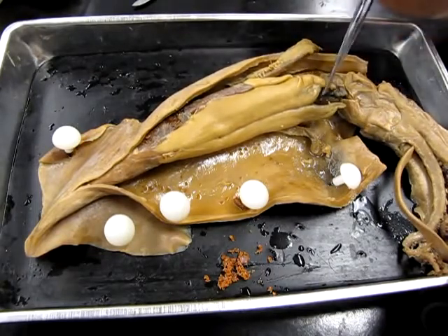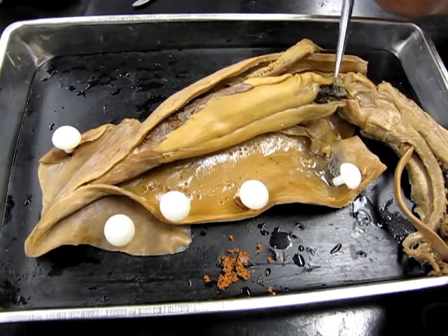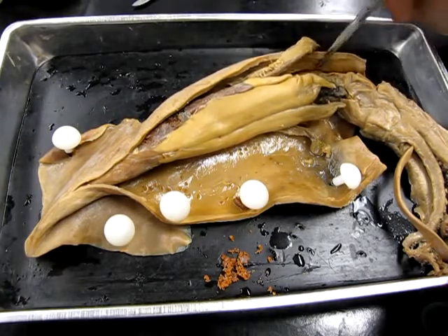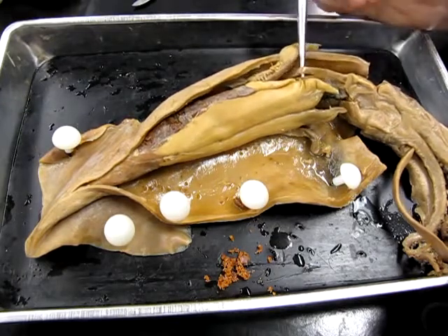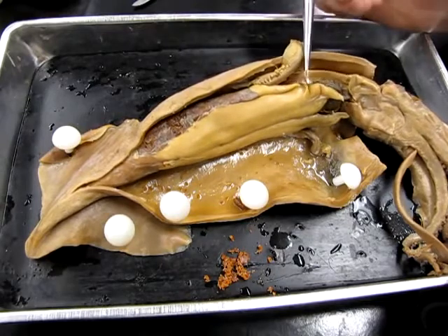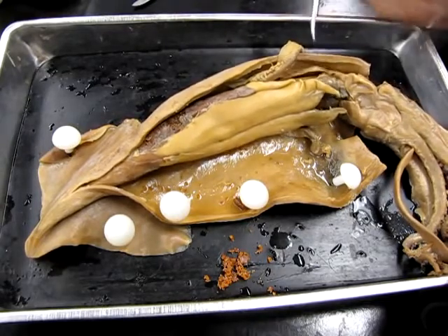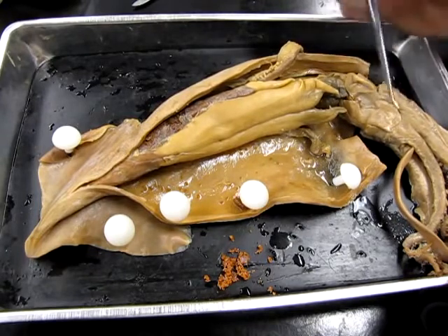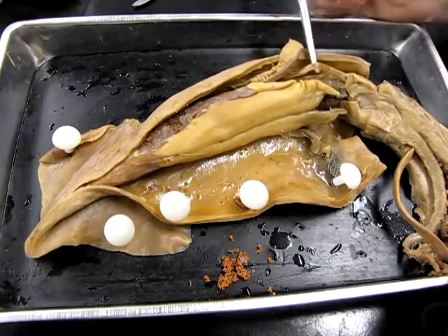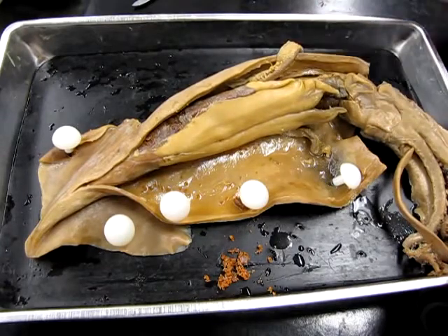The only other things I'll point out here, we can also see the ink sac on the female. It's this dark area down here, down below. And one other structure that's kind of interesting, you'll see this on the male also. This is a muscle that is used in retracting the siphon. So the siphon itself can be moved forward and back, and there's one of these structures on either side, and that's what those are involved in. So that is the female.